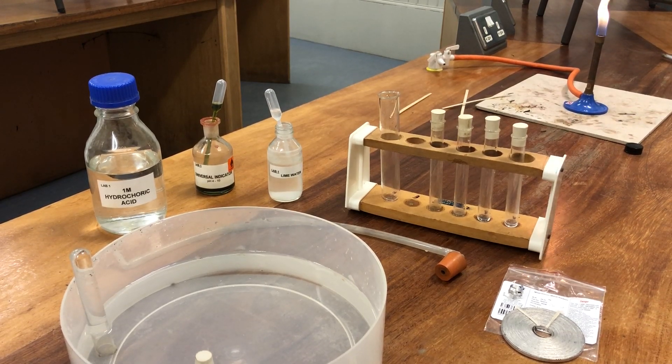In this experiment we will make, collect and test hydrogen gas.